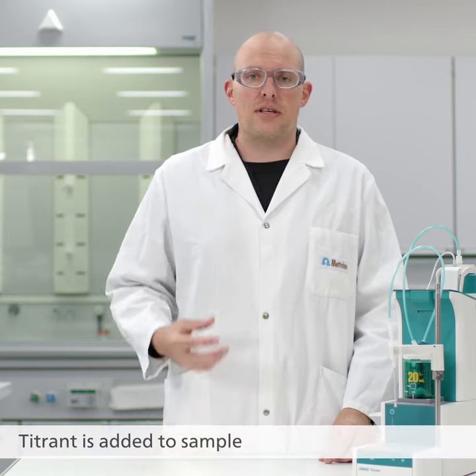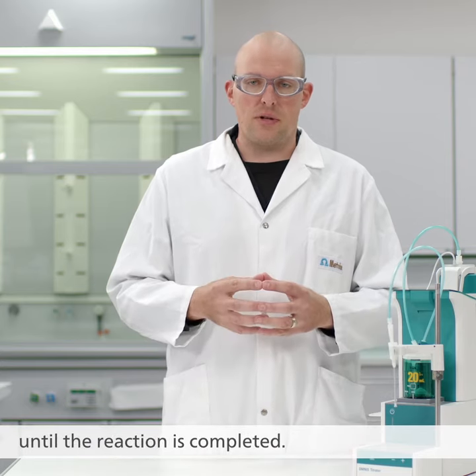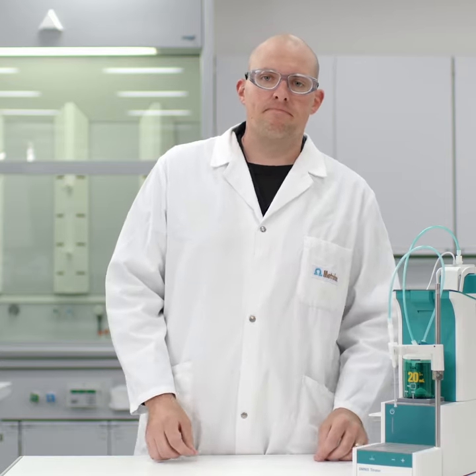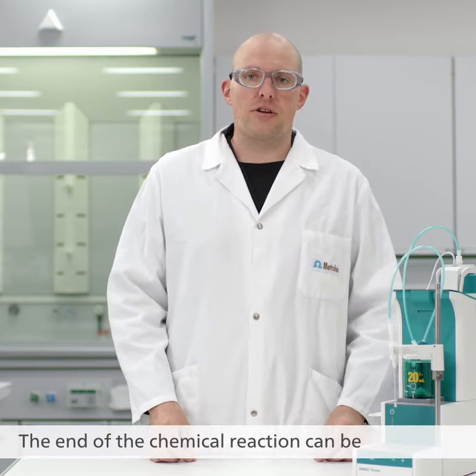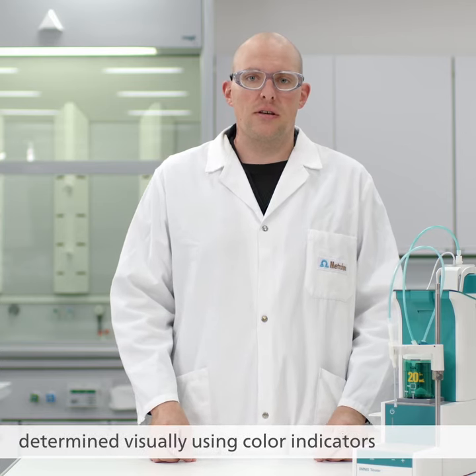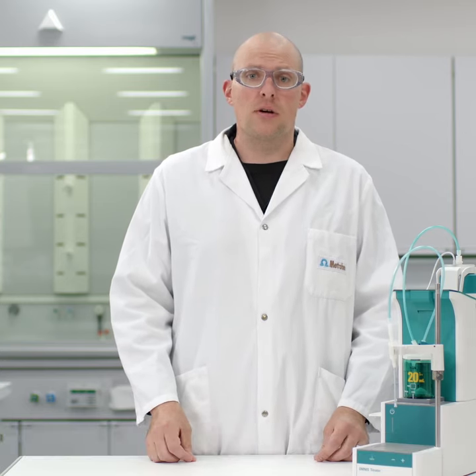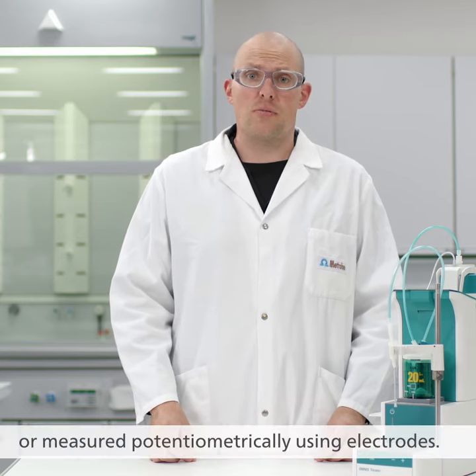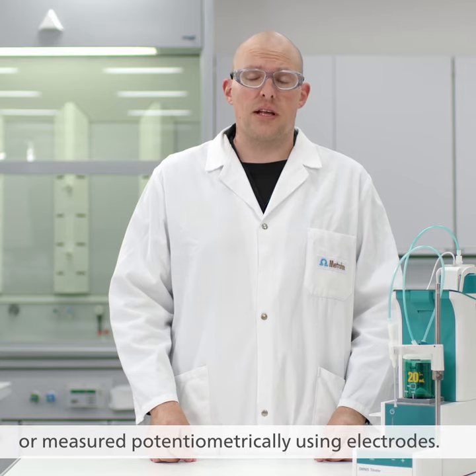Titrant is added to the sample until the reaction is completed. The end of the chemical reaction can be determined visually using color indicators, or measured potentiometrically using electrodes.